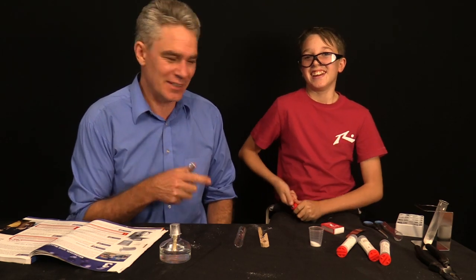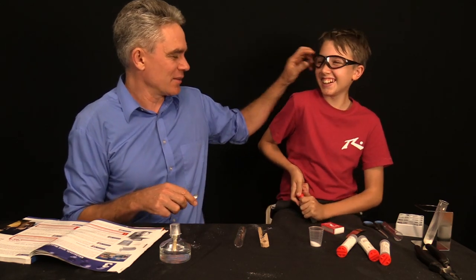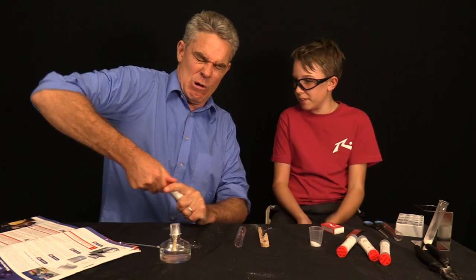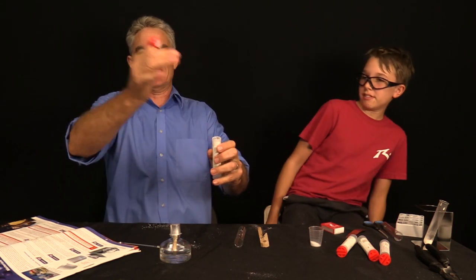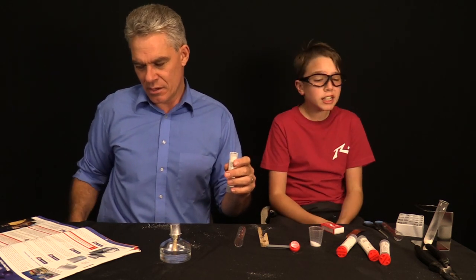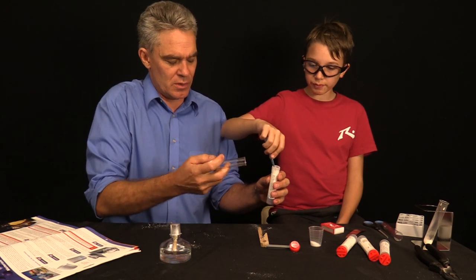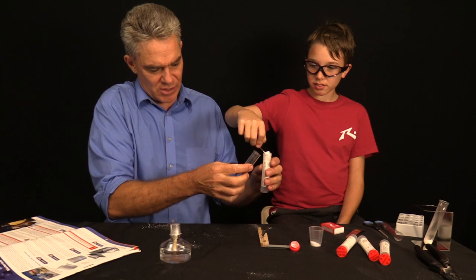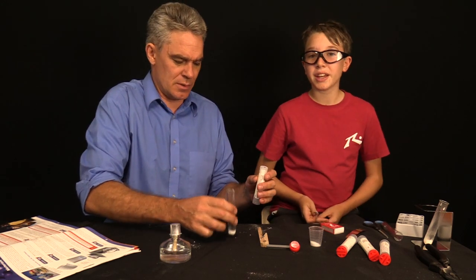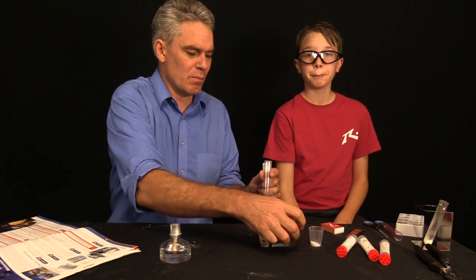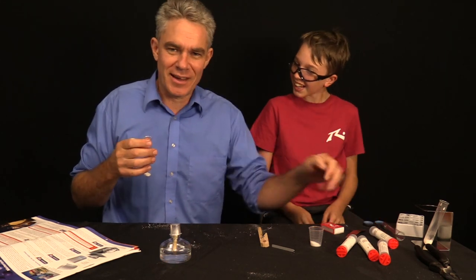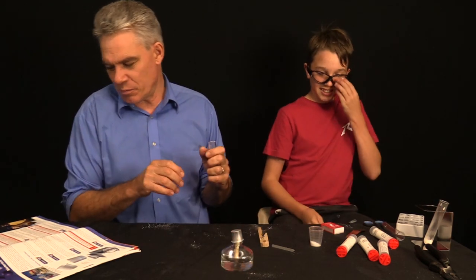Calcium hydroxide. It's a hydroxide. It's a strong base and you've got to be careful with strong bases. You can't even open up the lid. Come on, Grandpa. Let me get it for you. Sort of like a dust comes off. That's not good. Stay away. So, let's make sure we've got a clean spoon. We'll do one big spoon into the test tube. One big spoon. Calcium hydroxide, otherwise known as lime.